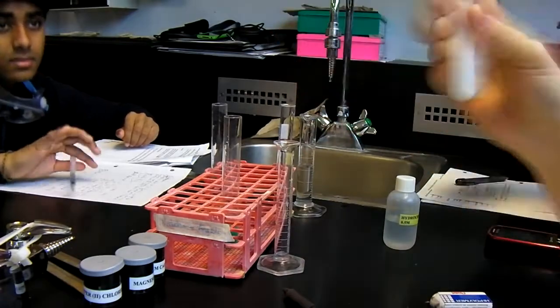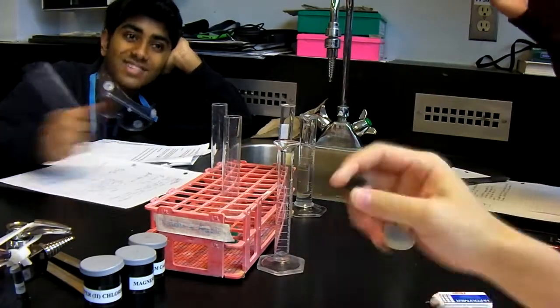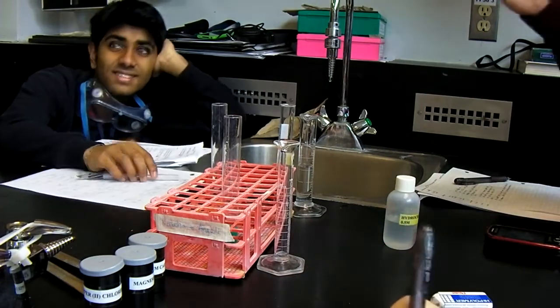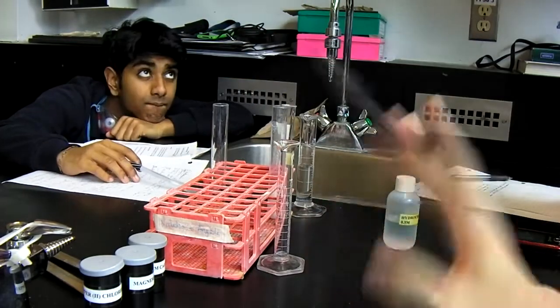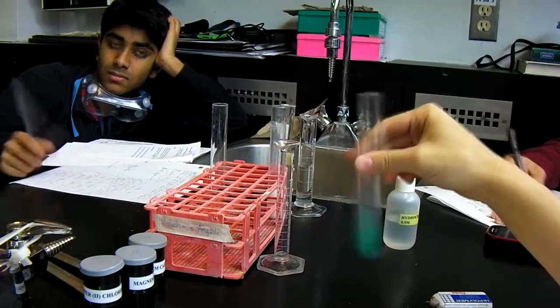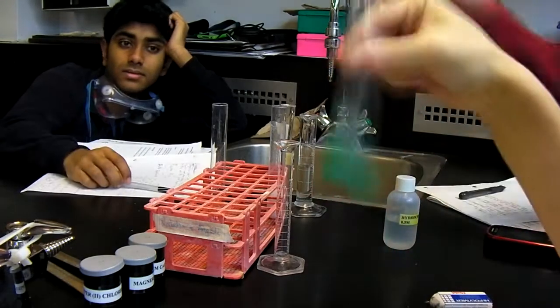Because we had to wait for the reaction to slowly dissolve, we worked hard, really hard, and wrote many notes on what we saw, and we didn't play around. For the purpose of science. We mildly amused ourselves for 10 minutes. But here you can see it's fast forwarded, so you don't have to go through it. That badly.